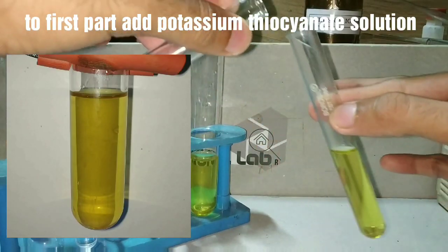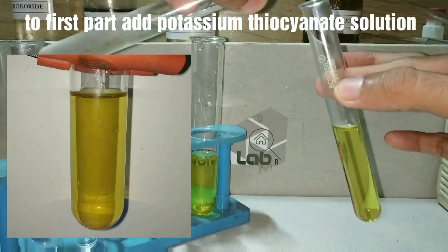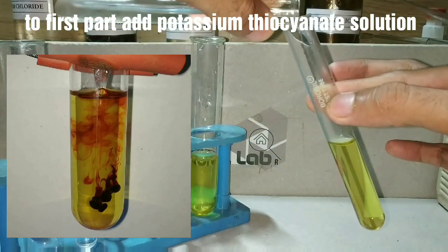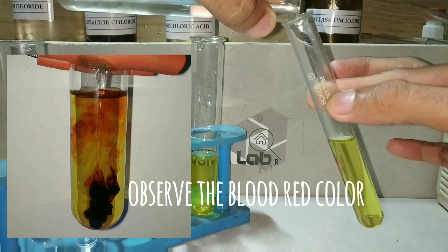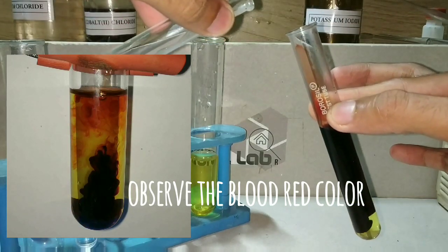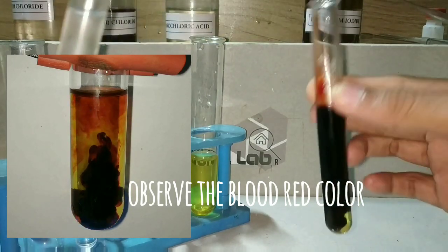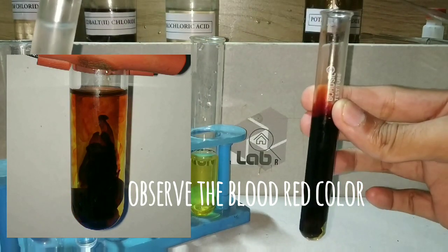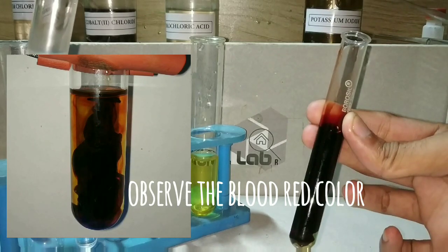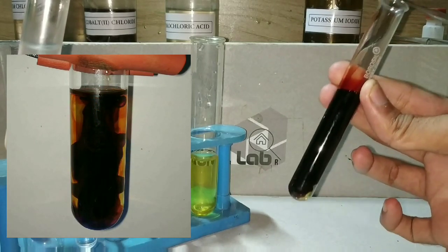To the first test tube I am adding potassium thiocyanate solution. You can see that on adding the potassium thiocyanate there is formation of a blood red color.